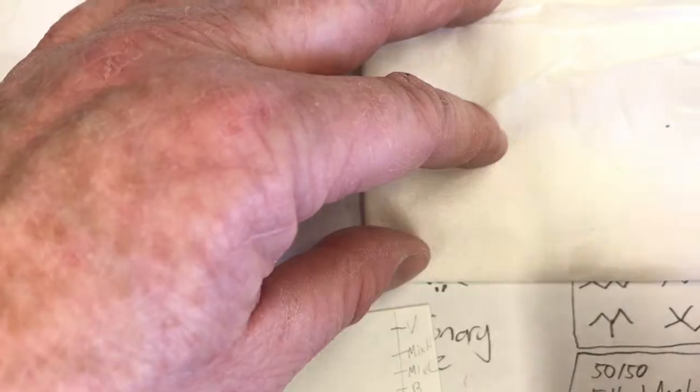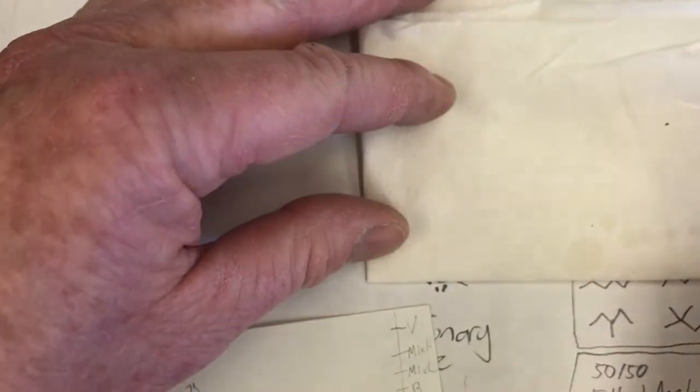Okay, I break off that tip, put it in the waste container, get my mix. So here it is, benzophenone vanillin mix. Paper towel, real nice. A little more. Okay, so this is the mix. So let's go mix heavy, spot light, spot heavy again, heavy a third time, boom. Okay, looking good on that one.